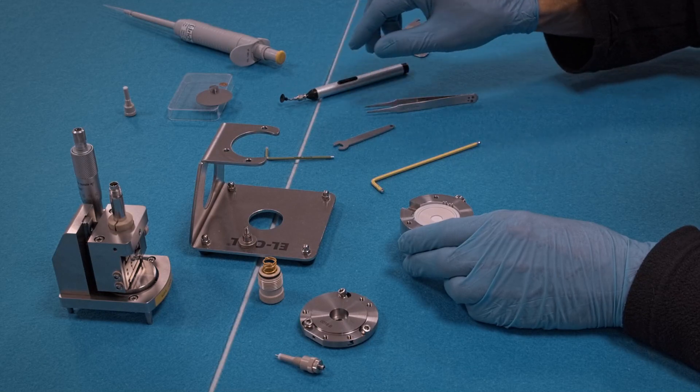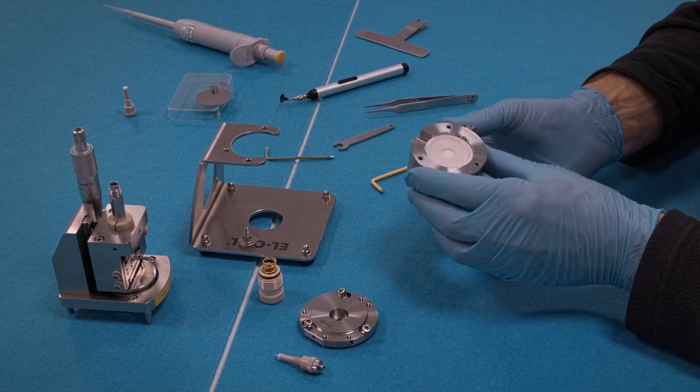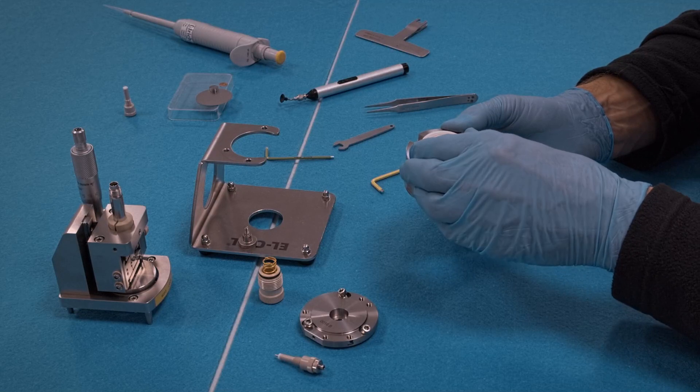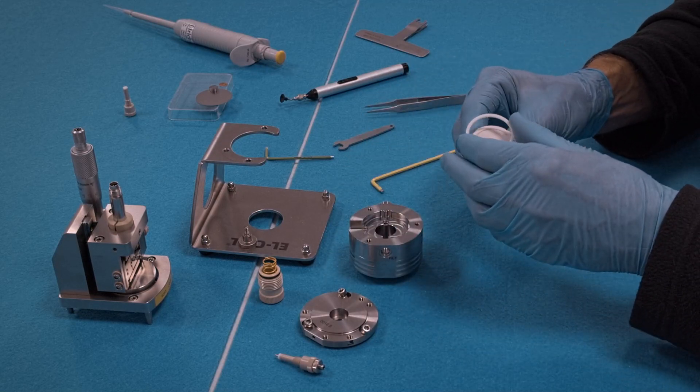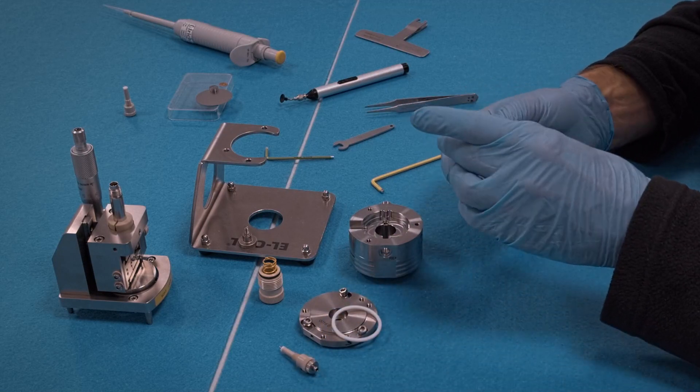Push from below the assembly, the frit flange out of the base. Dispose the PTFE seal. And now this is an important step: we remove the piston.